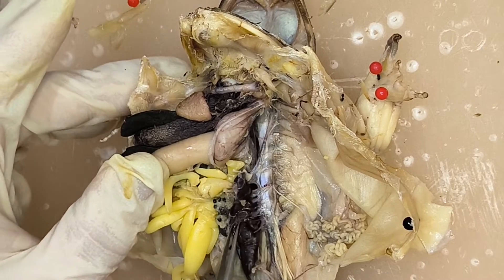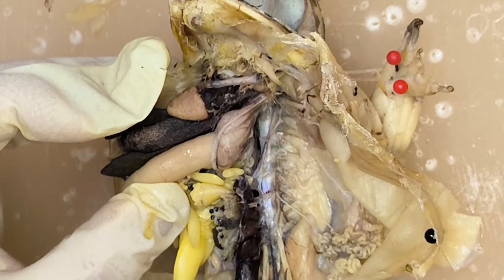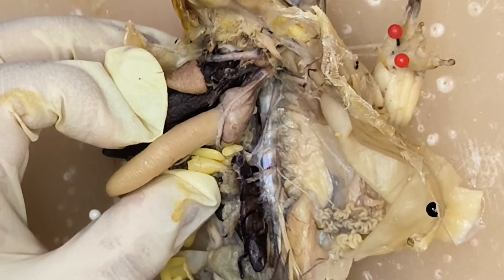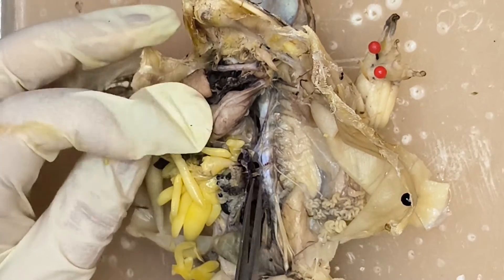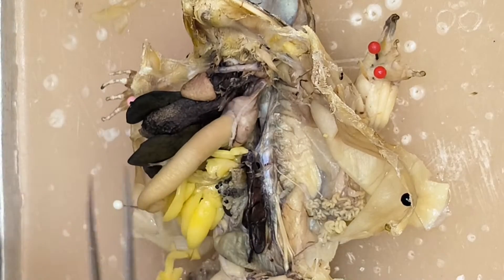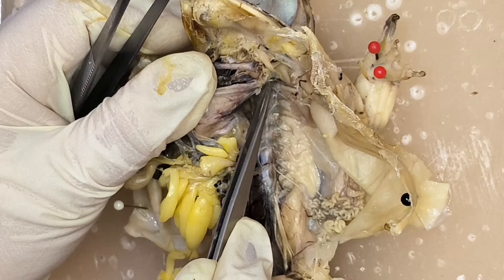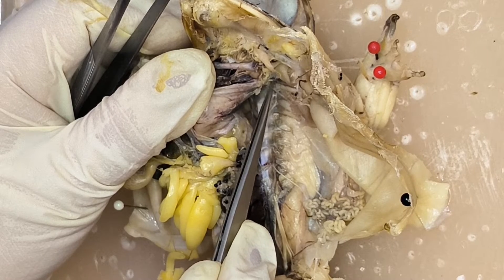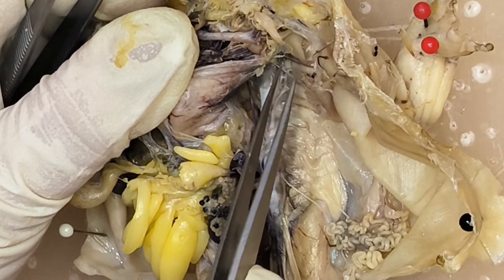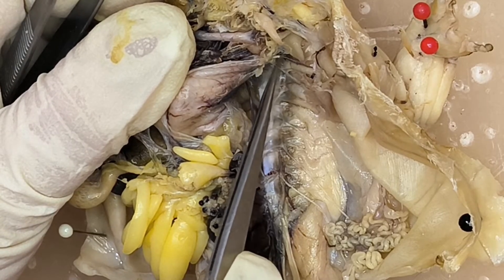In the previous vlog, we discussed how to identify a nerve from an artery or a vein — nerves are somewhat yellowish in color. So here is the first set. This is the first spinal nerve, the hypoglossal nerve. It is adjacent to the subclavian artery. The yellow part — that is the first spinal nerve or hypoglossal nerve — innervating the tongue and the hyoid.